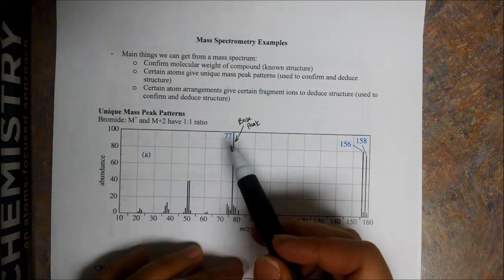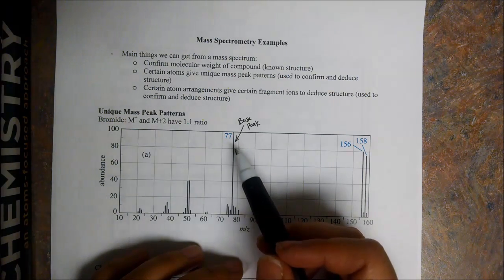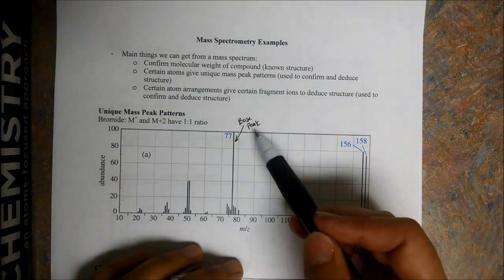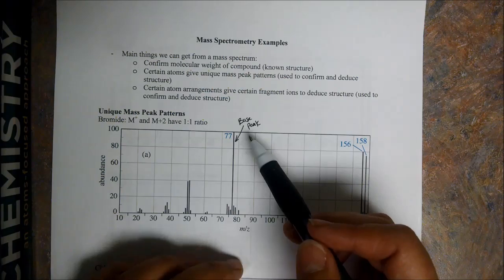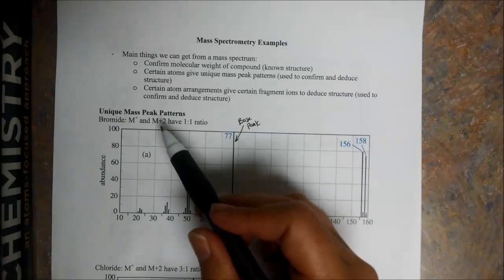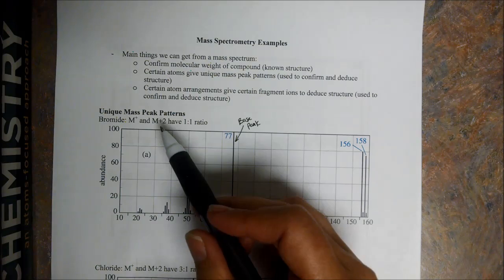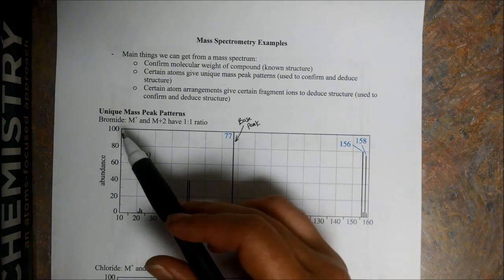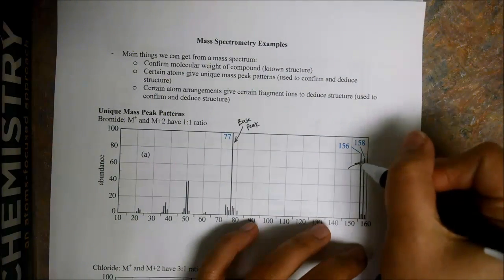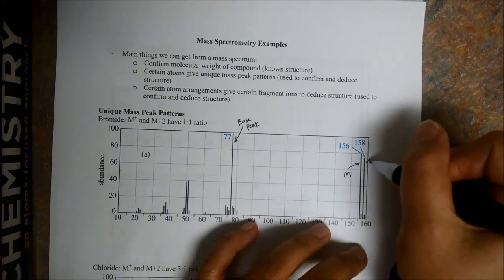It can help us deduce some things, as in if this is the most common ion, then there's a reason for him to be there. But really just the largest ion, or the ion of greatest abundance, we just call that the base peak. Okay, so then over here, these are the M and the M plus 2 peaks that I'm talking about. Okay, does anybody know why we have an M and an M plus 2 peak, and why they might have a 1-to-1 ratio in this spectrum? Hold on, let's label them. This is the molecular ion, so here's our M, and then this guy is our M plus 2.